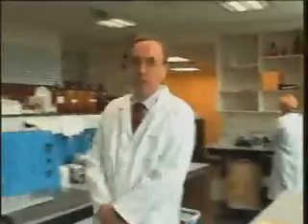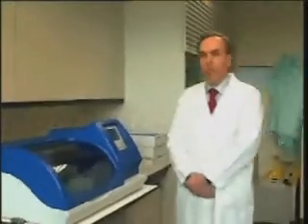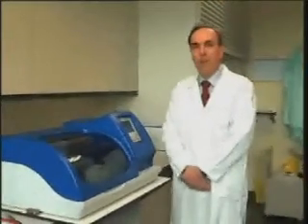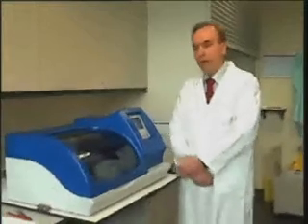Welcome to our lab. My name is Dr. van Dijk. I am the head of the laboratory, and for one year we have been working with CellSlide as our thin layer processor for preparing samples of gynecological cytology.